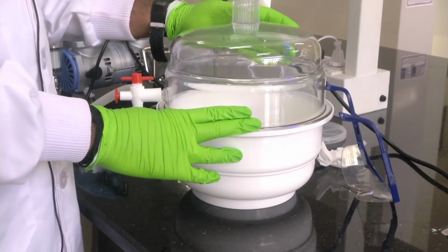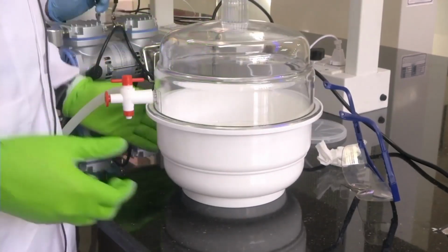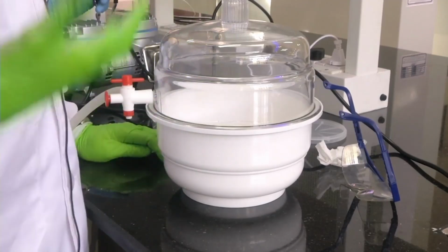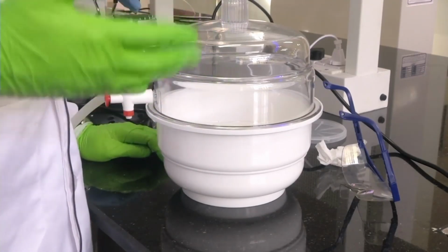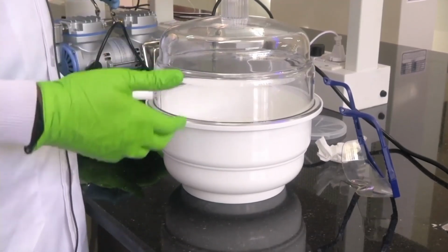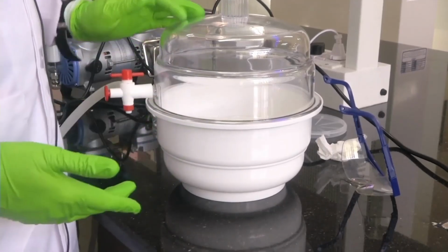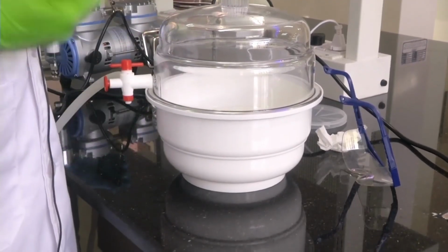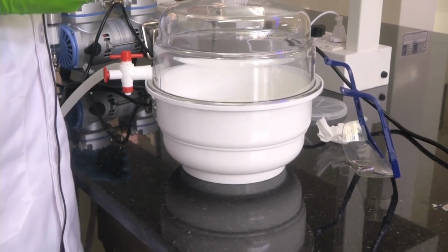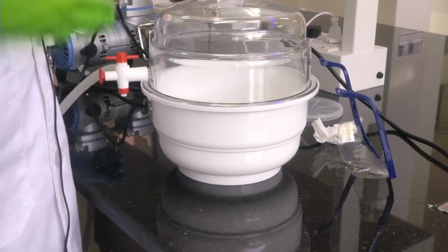So now we have desiccated it for almost 15 minutes to remove the air bubbles. What we have done, we have kept the thoroughly mixed PDMS and curing agent, which had a lot of air bubbles in it, inside the desiccator and we are trying to suck out air and create vacuum inside the desiccator. In that process, whatever air bubble is embedded within the liquid comes to the surface because it is getting pulled by the environment. So all the air bubbles will first come to the surface.